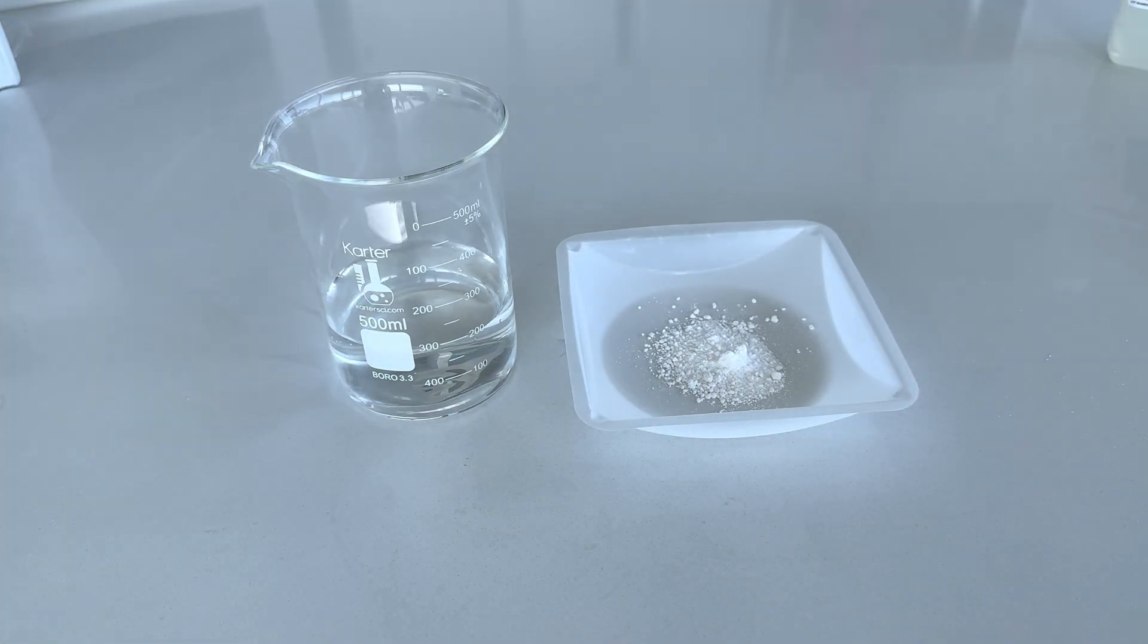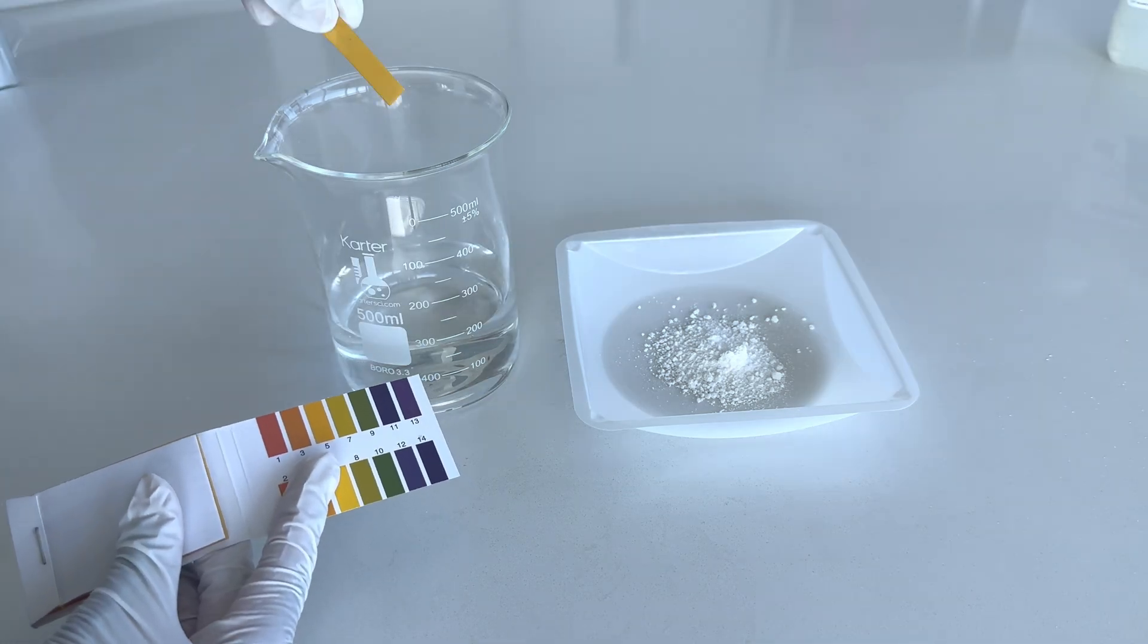First I start with a beaker of deionized water which was pre-measured off-camera. I use 197.6 grams of water.